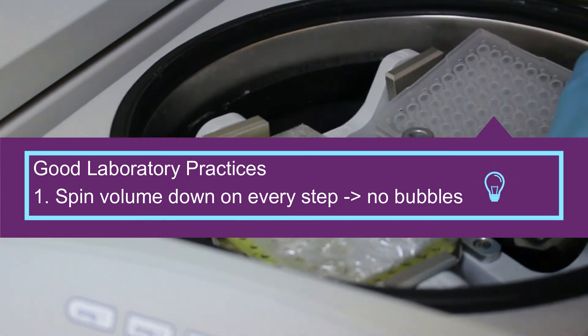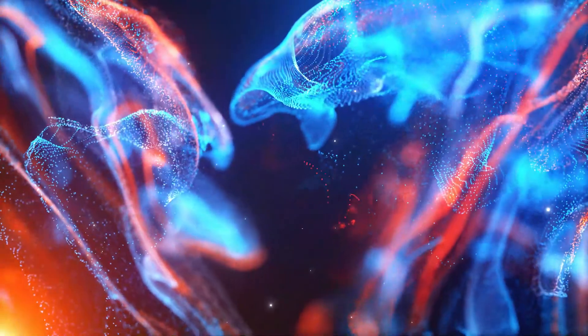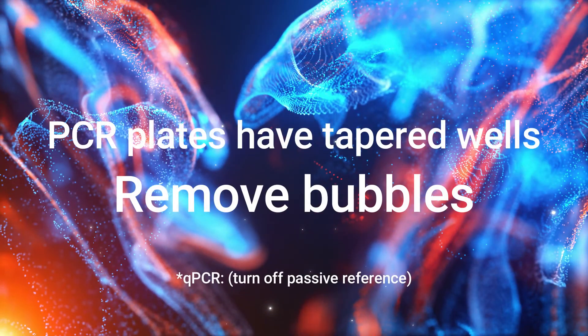There you have it folks. The most common mistake is not removing those bubbles. Bubbles beware. That and, oh yeah, we don't use a passive reference so make sure that's turned off on the QPCR machine.